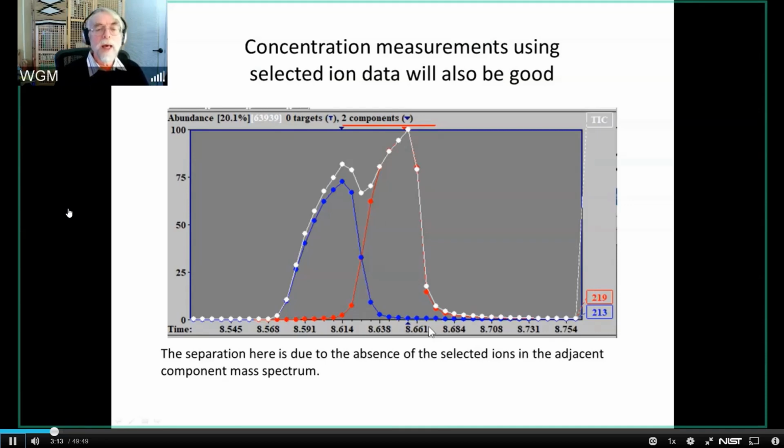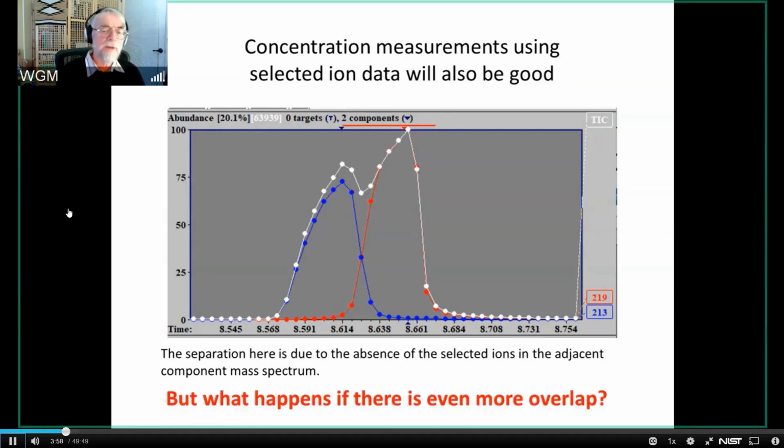So when we have separations like this, that is to say that we actually have a real minimum in the TIC, there's a good chance that we're going to get really no fundamental problems with understanding what the components are and getting the areas for them. Now, there is one caveat for this, and that is that if these two spectra are extremely similar, then you can begin to have problems. But this isn't the only thing that we could say represents co-elution. Let's ask what happens if there's even more overlap.